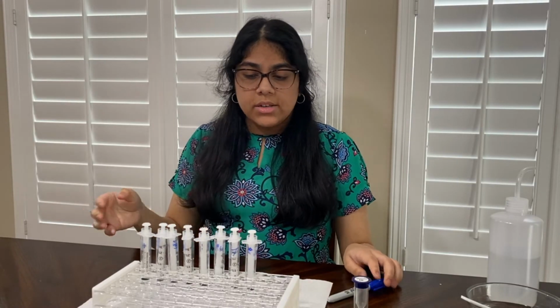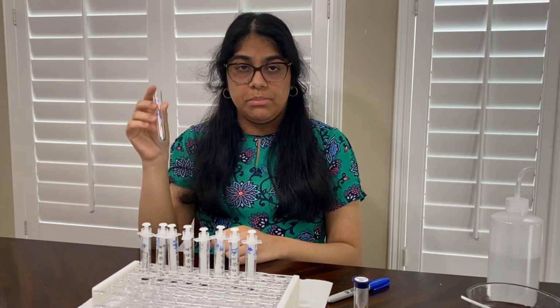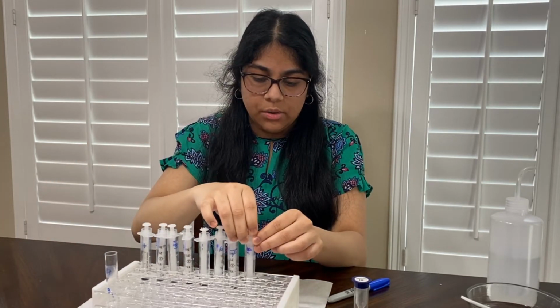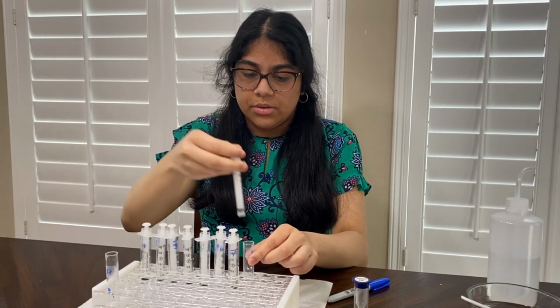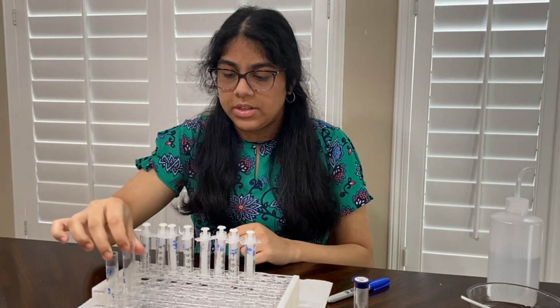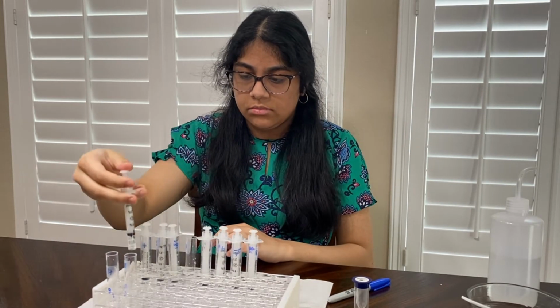So here I have my 8 individual samples, and I'm going to start off by creating my first pool test. I labeled it test tube B1, and this has sample number 8 only. So I'm going to take 0.5 ml, just like with the Dorfman, and put that into this test tube. And then so on with B2, which represents the second pool test. This is going to be 4, 5, 6, and 7. So 0.5 ml from each again.